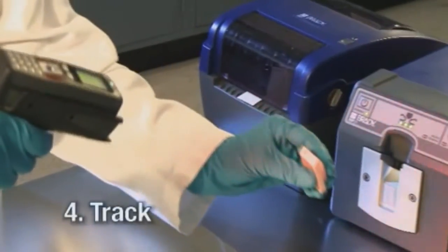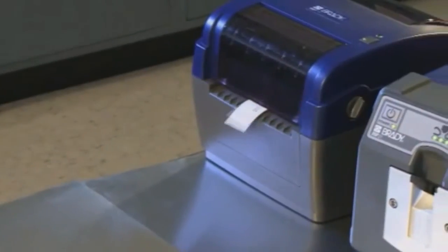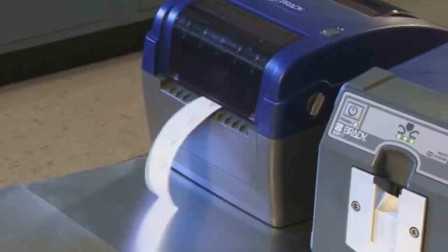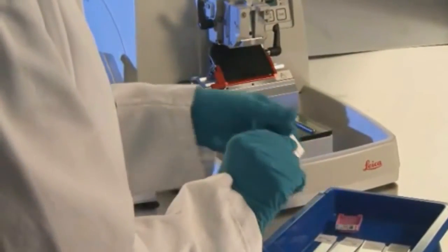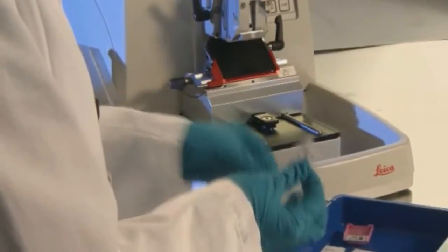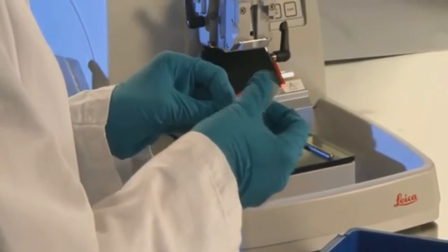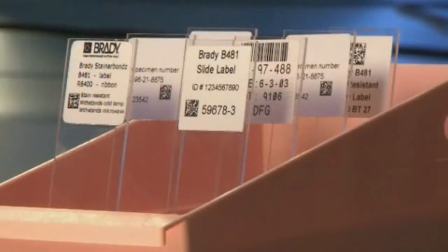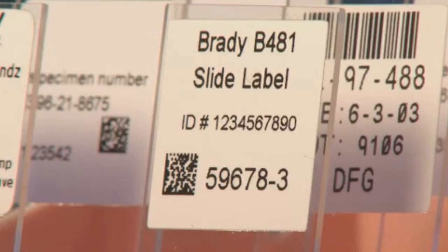The scanner will read the information and send it to the host system. Slide labels can then be printed directly from the Brady BBP11 printer, which can automatically create the necessary number of slide labels for each specimen block. Brady's stainer bond slide labels can be applied pre-processed and withstand most soaks and staining protocols. Testing has shown the labels remain clear and legible for up to 20 years in storage.